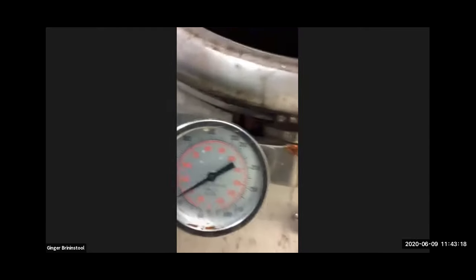So inside, looks something like this. You can hear my voice changing now that I'm halfway in the chamber. No, my head's just sticking in. If it were a really hot autoclave just finished, you would not be able to do that. But you can only open the autoclave door when the pressure is 0 and the temperature has gone under 100 degrees, right? And it's well under 100 degrees Celsius, so we could open it.